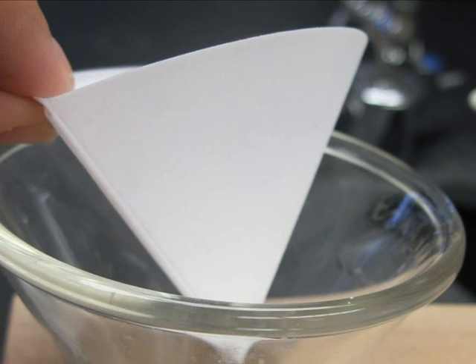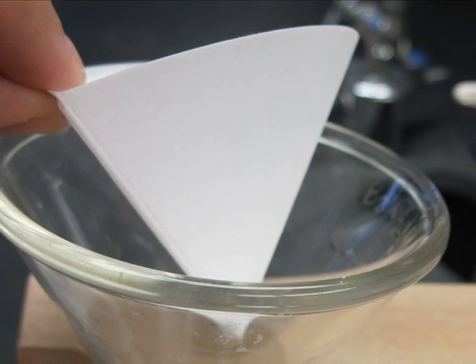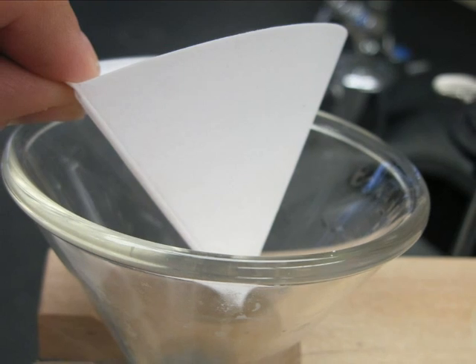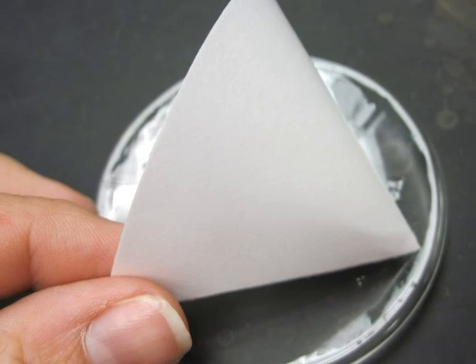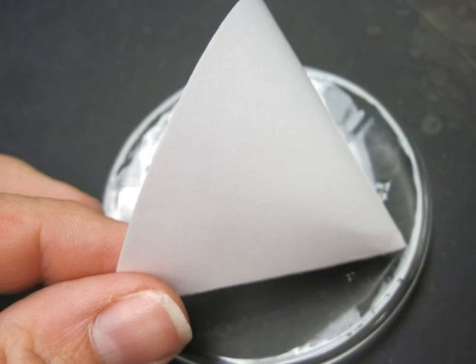Remove the filter paper from the funnel. Use caution as wet filter paper tears easily. Place the samples on a watch glass. Be sure to label the watch glass with your name and sample number.